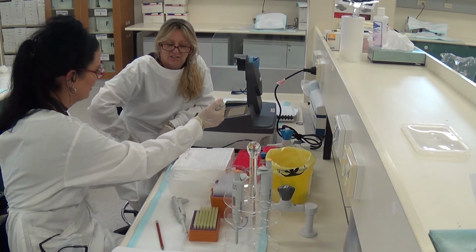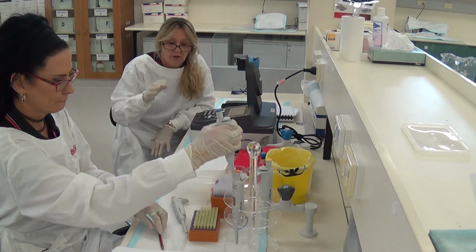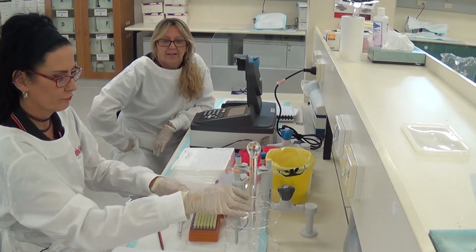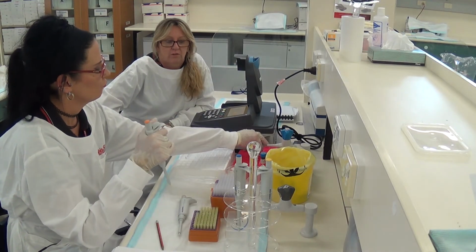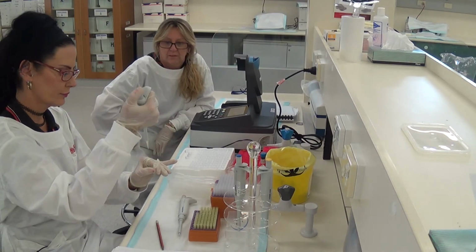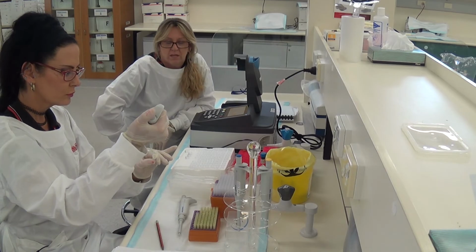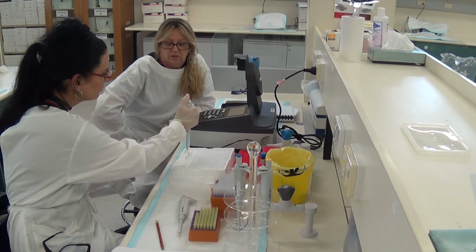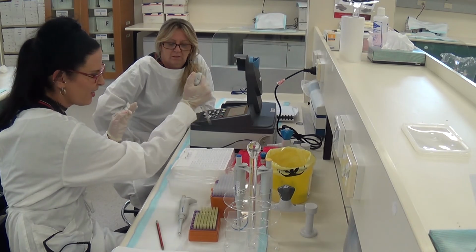All right, so in goes our 900 microlitres of NAD plus, just like we did the first time. Now we're going to add 100 microlitres of 0.5 molar ethanol. So half the concentration of the first one. So while we're doing this, have a think about it. What do you think the numbers are going to do if it's half the concentration?